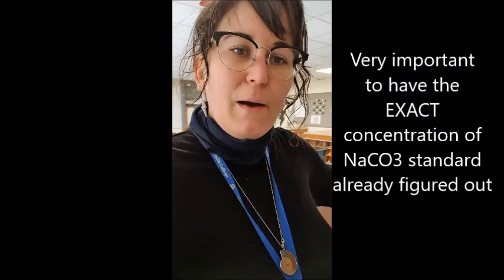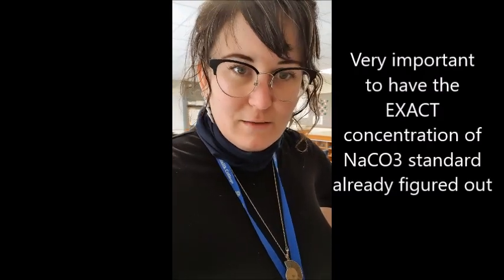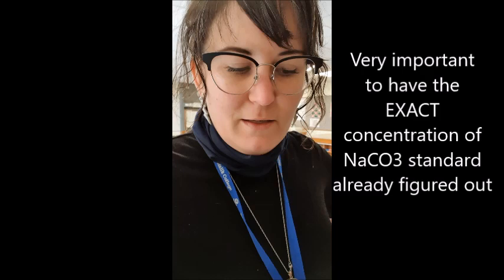Hello again, year 11 chemistry students. So now I'm going to do a titration with the standard solution that I made earlier, the sodium carbonate, and we're going to titrate brick cleaner. But the brick cleaner is basically made up of hydrochloric acid.